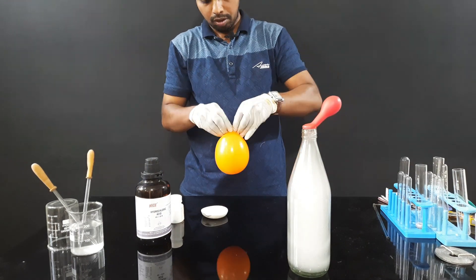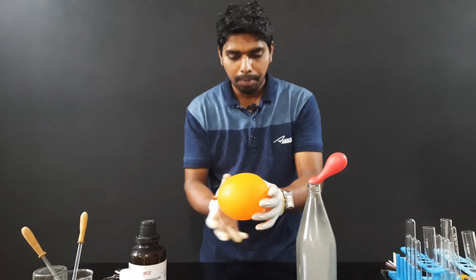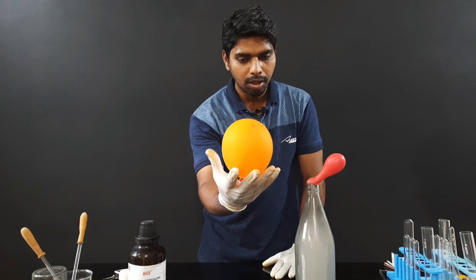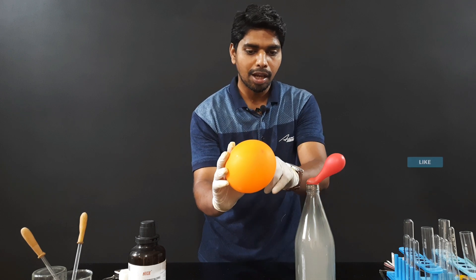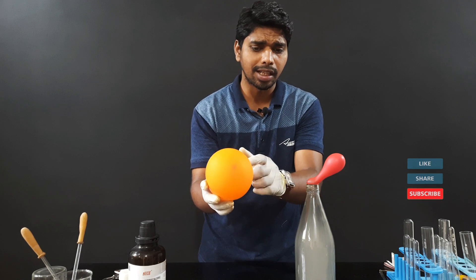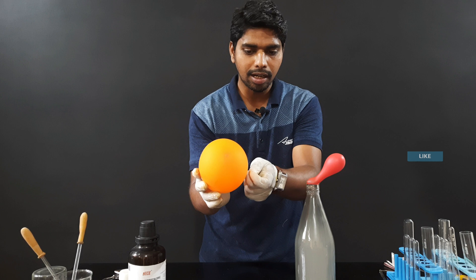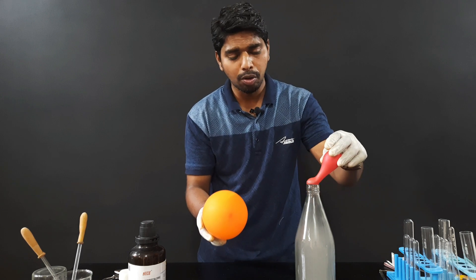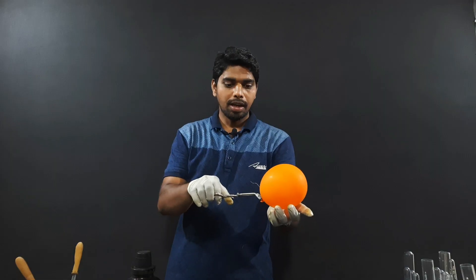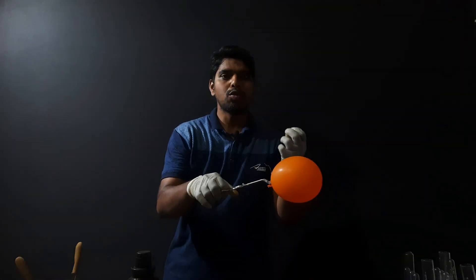Let's do the last video — you can get a blast. The balloon is filled with hydrogen gas, a light gas. When a fire is touched to it, a small light blast occurs.